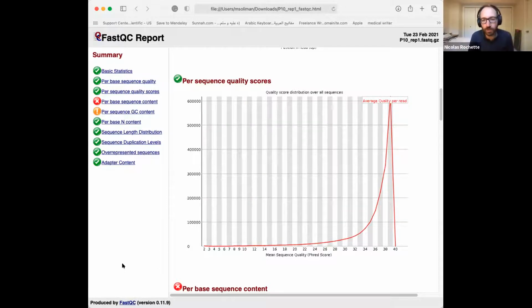And the reason why the exercise PDF asks you to compare the two samples together is that we're not sure exactly what the data should or should not look like. We have some general ideas: the qualities should be above 30 for most of the read, and the reads should be homogeneous. And a few others I'm going to mention in a minute. But the main criterion, if we're looking for outlier samples, like RNA extractions that haven't worked properly or issues with library prep, is that all samples should be similarly good or similarly bad.